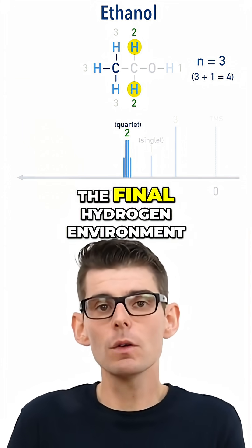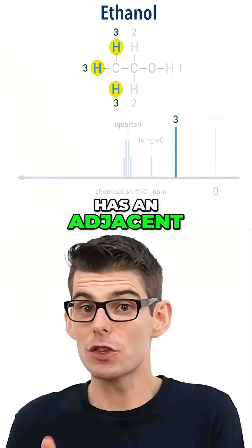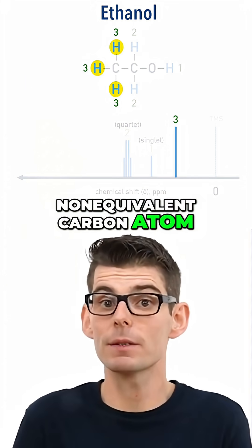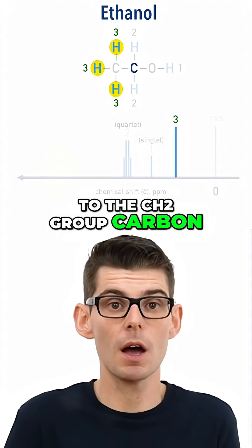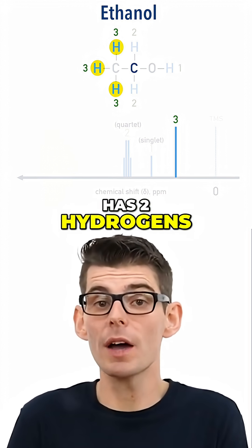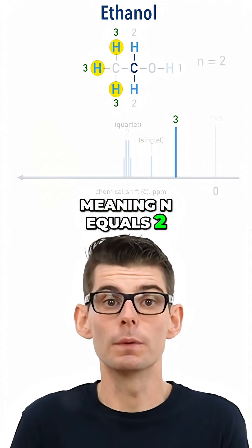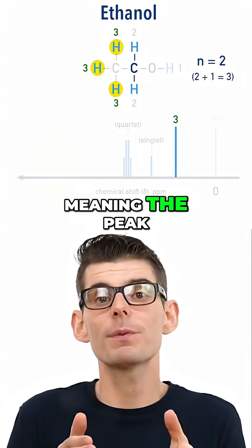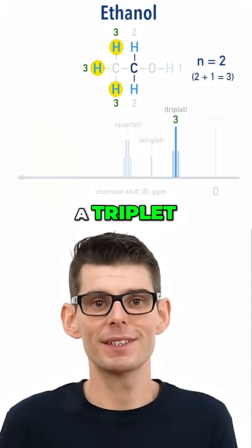The final hydrogen environment, the CH3 group, has an adjacent non-equivalent carbon atom that it is bonded to — the CH2 group carbon. This carbon has two hydrogens bonded to it, meaning n equals 2. 2 plus 1 is 3, meaning the peak gets split into 3 — a triplet.